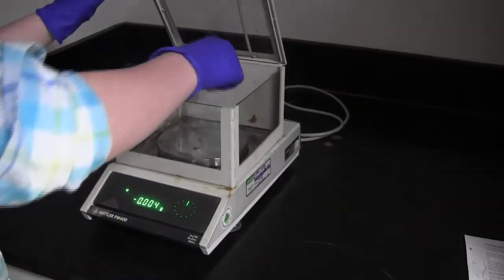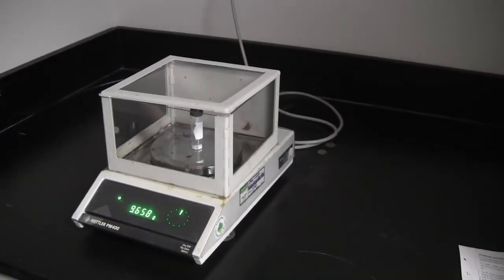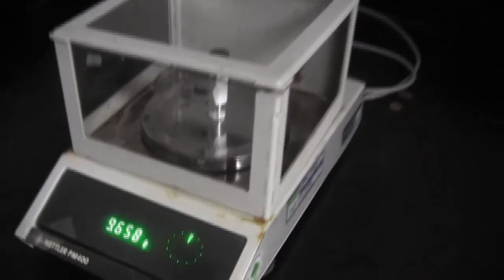When the sample is dry, weigh the vial again, and use the previous number to figure out the difference in mass. This will tell you the mass of the unknown that you collected.